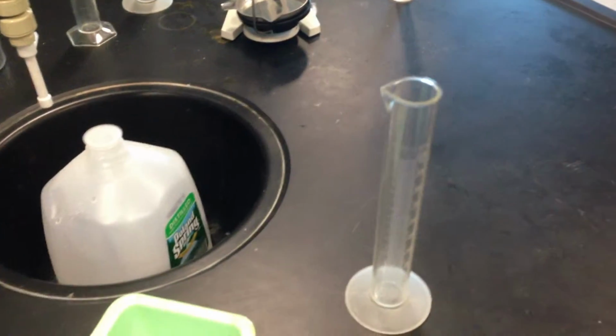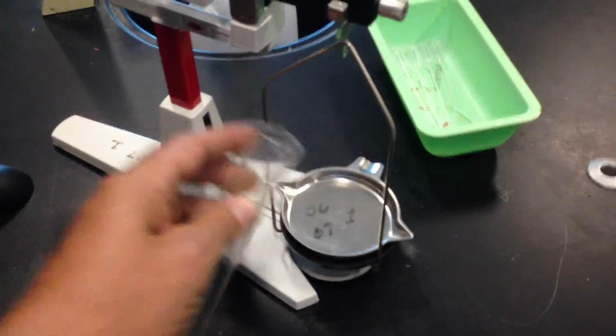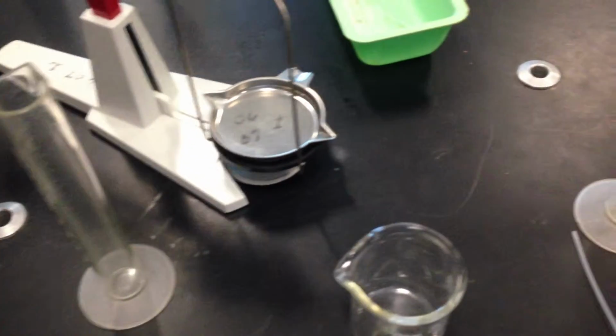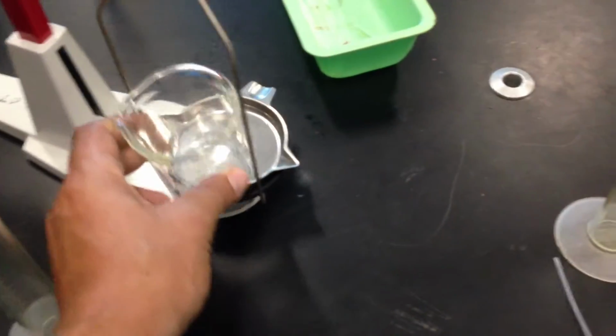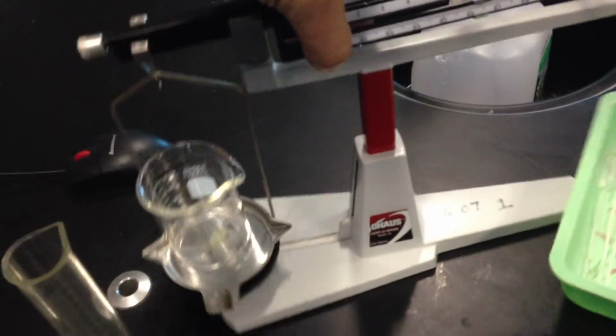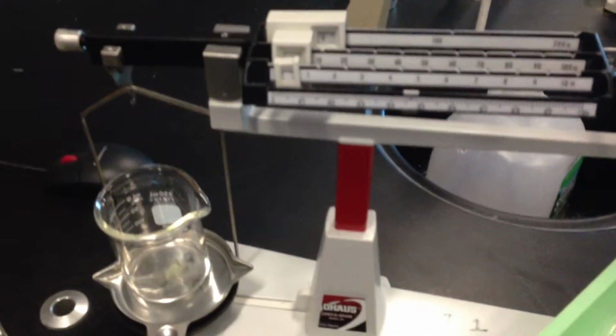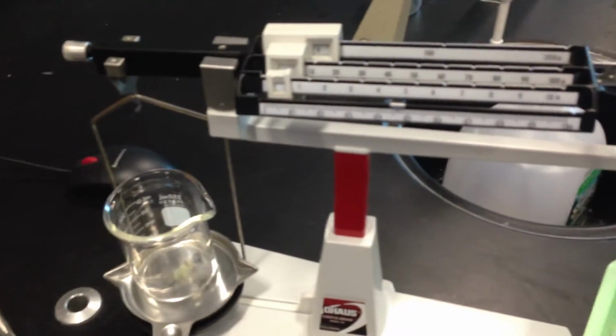Okay, no problems. Now, once we have measured our liquid, we have to mass our liquid. Now, of course, we can't pour the liquid on the triple beam balance. That'd be silly, but I've had someone do that, believe it or not. You're going to take a dry beaker. Now, this beaker, okay, you can mass out. And I'm not going to mass it out here, but you can mass it out once and use that mass 3 times if you'd like, and that's part of your design if you want to talk about that.